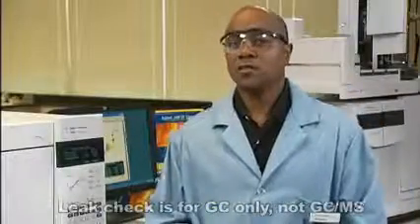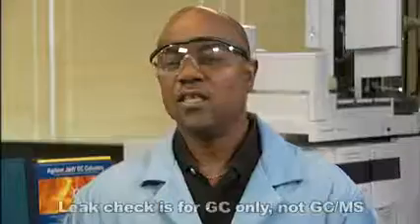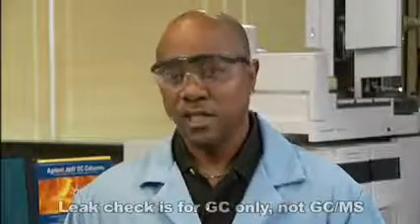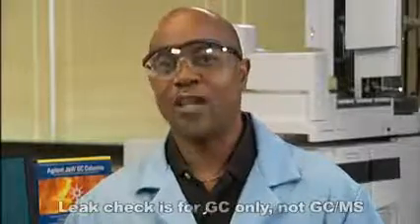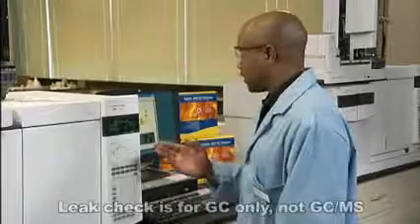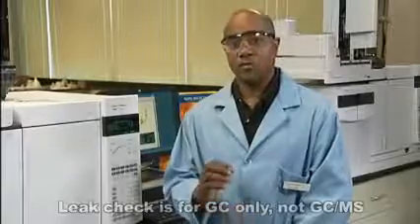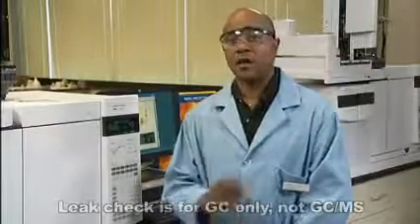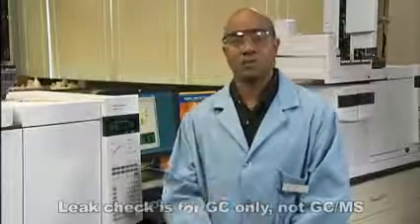We'll monitor the total flow from the GC display while tightening fittings. If the total flow is much greater than 10 mils a minute, there's a leak or your column settings are not accurate. Okay, we have a leak. Tighten the fittings and watch the total flow reading. Over-tightening the fittings could also be a problem, so use caution.